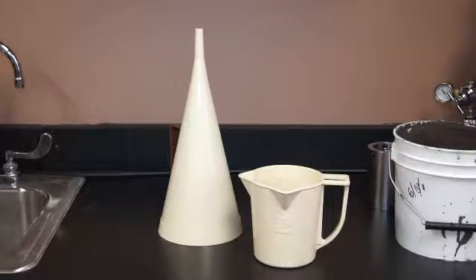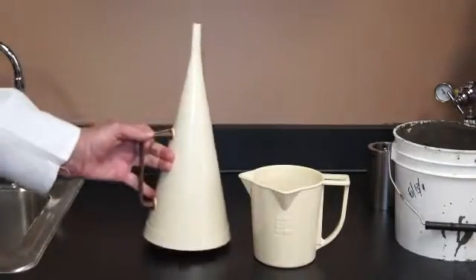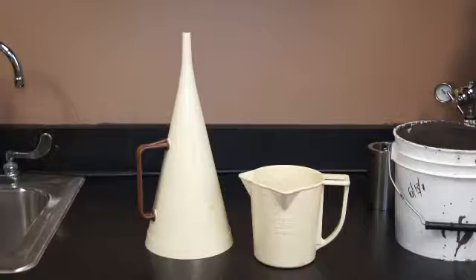The beauty of this instrument is that it is very simple to use and anyone can readily understand the principles here. Pure tap water takes 26 seconds, plus or minus a half a second, to flow out the bottom of the orifice or the cone here. Thicker fluid will take 35, 40 seconds, 45, 50 seconds, and so on. So it's a relative viscosity against water. And of course water has a specific gravity of 1.